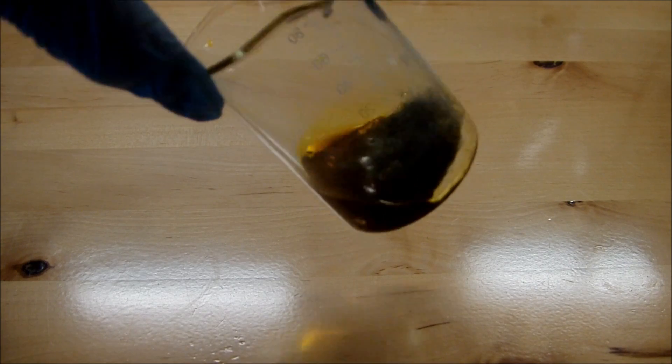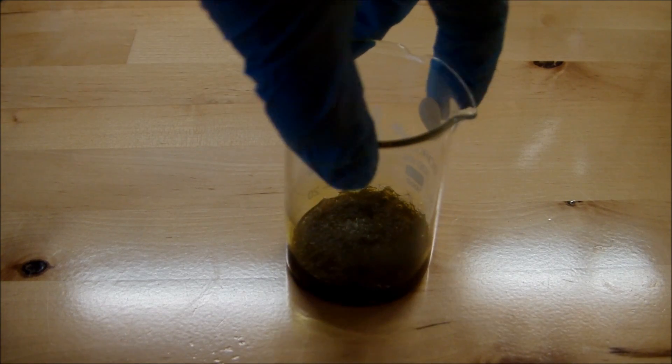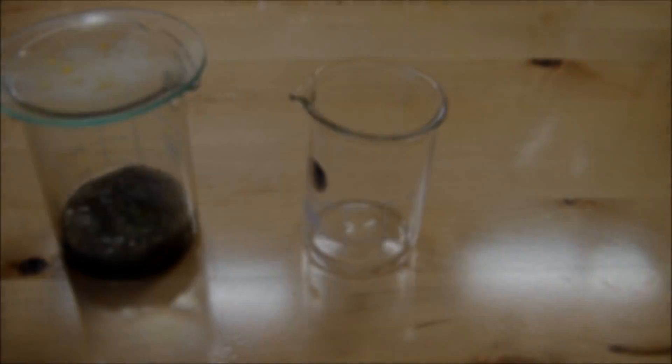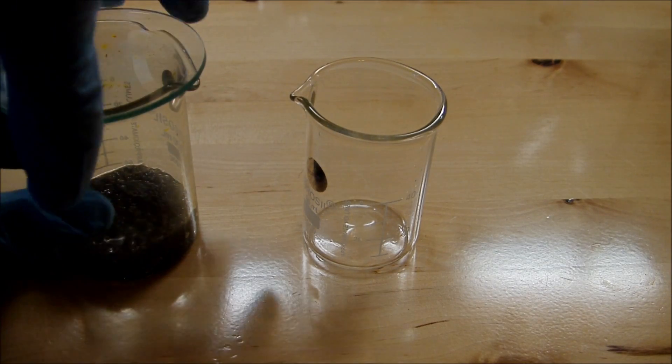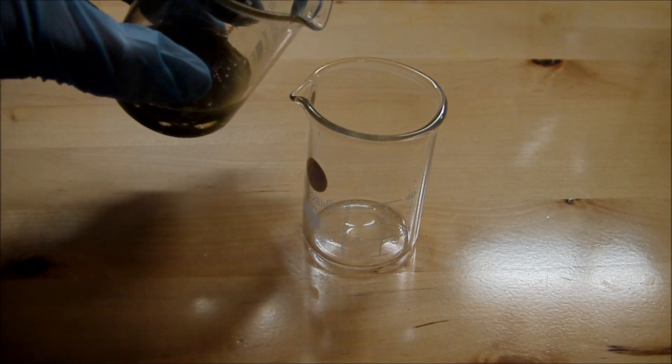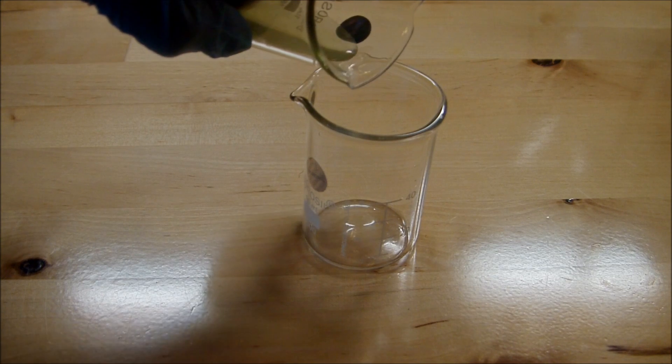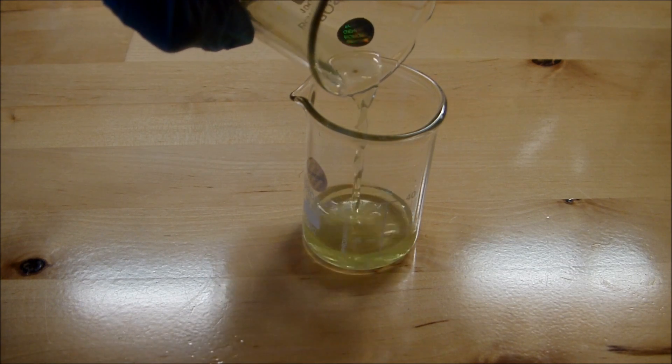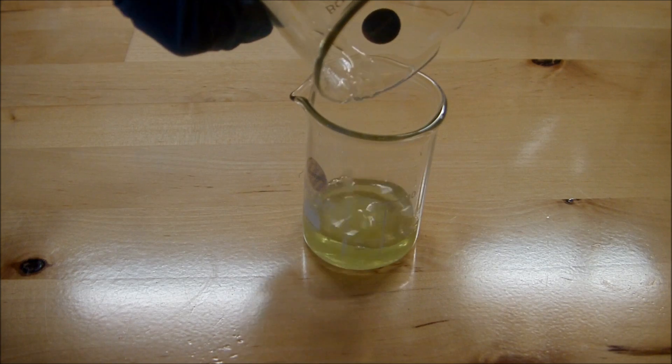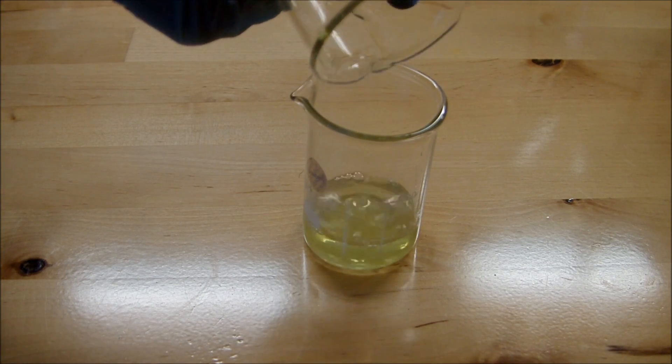You can see the color is lightening a little bit. This has been left to react for a few minutes and as you can see I've now regenerated my iron 3 chloride back to iron 2 based on the nice color change.